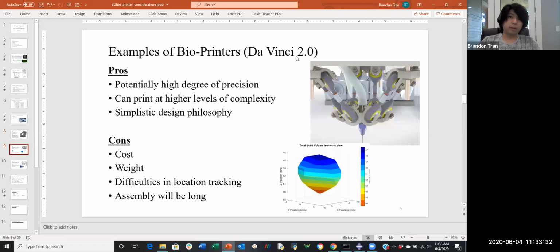The next one I want to talk about, I call the Da Vinci 2.0 because it just looks like the Da Vinci device. It has more than 4 axis support for printing the material. I think this is the most unique design I've seen.